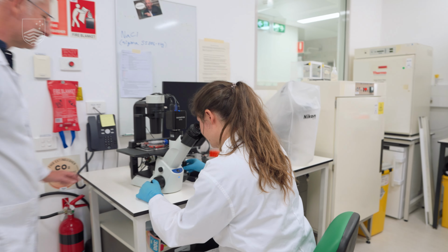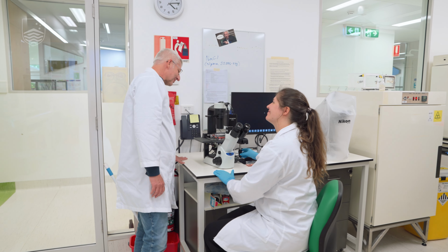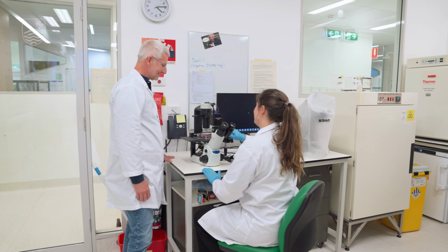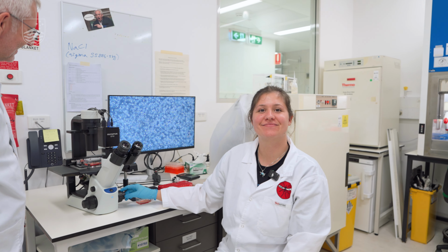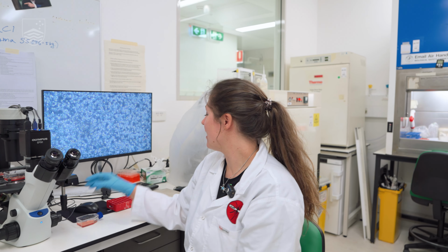Hi Linnea. Hi Alex. You're looking at trypanosomes, aren't you? Yes, I am in fact. Do you want to have a look? Yeah, that would be great. Wow. Lots of small little unicellular parasites in there. Where did you find them?